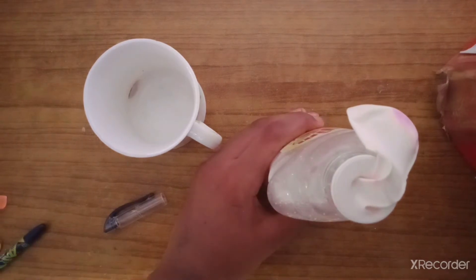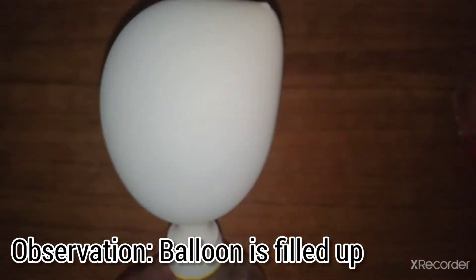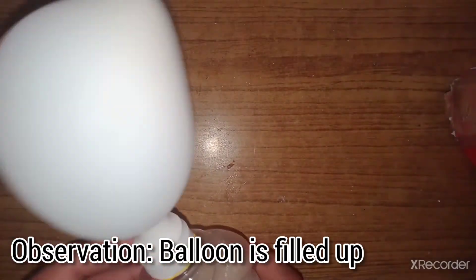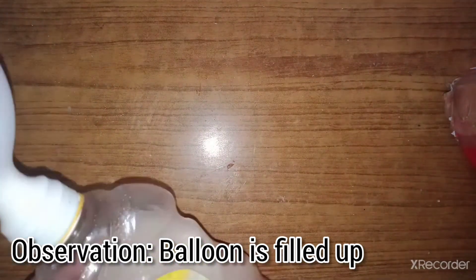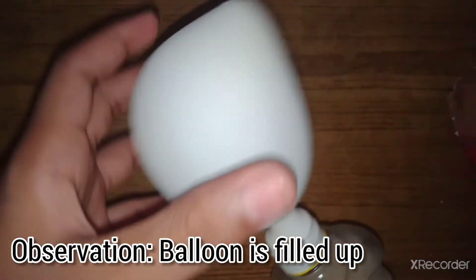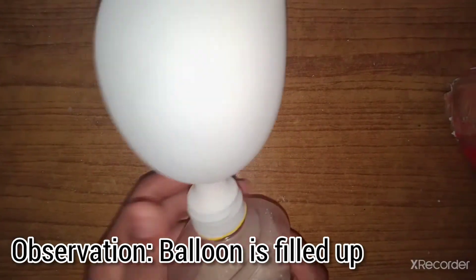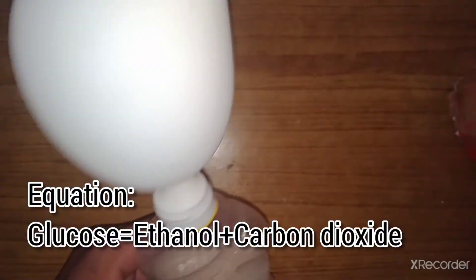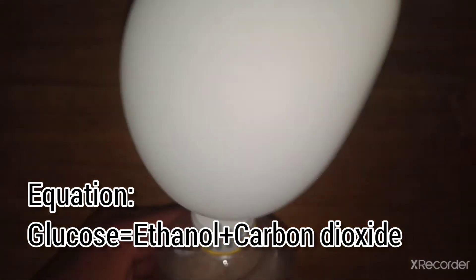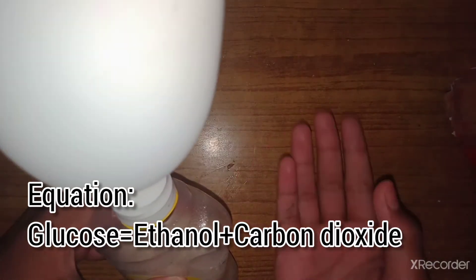We have to wait for a few minutes or sometimes a very long time. I am back with my balloon after 60 minutes — this is the end part of the experiment. You can see that the balloon is much more filled than when it was first recorded after 10 minutes. This is because of the carbon dioxide that has filled it.